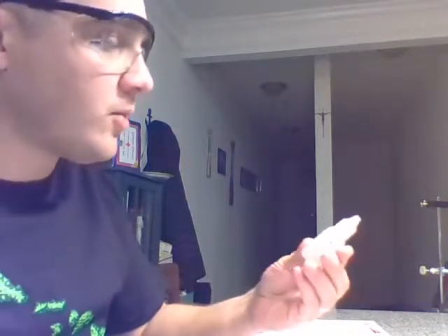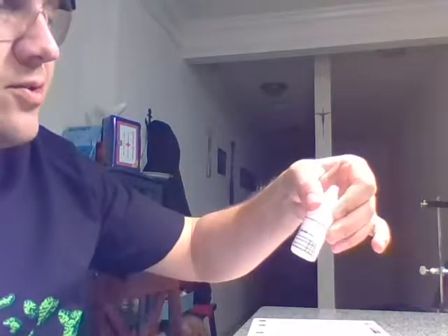And there's my lithium chloride, my 5 milliliters. I've got my 5% sodium chloride, 5 milliliters. I've got my potassium chloride, 5 milliliters, and my calcium chloride solution, and that's 5 milliliters. I also have my matches right here. I'm considering grabbing a lighter, but I didn't want to use anything that I didn't have to. We'll see how the matches work with the candle. It shouldn't be too hard.